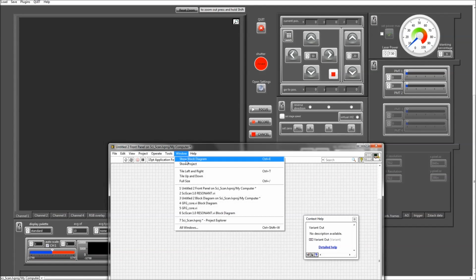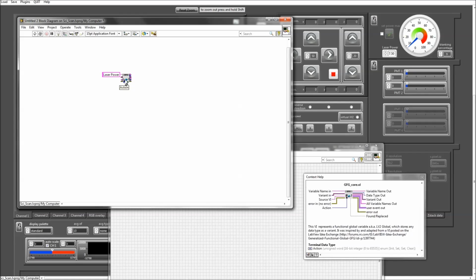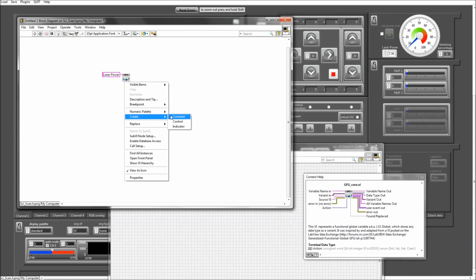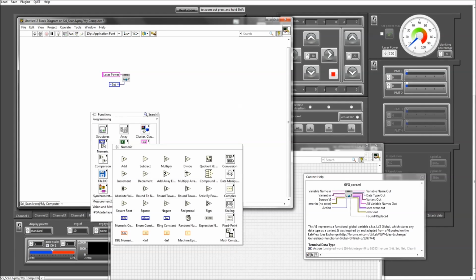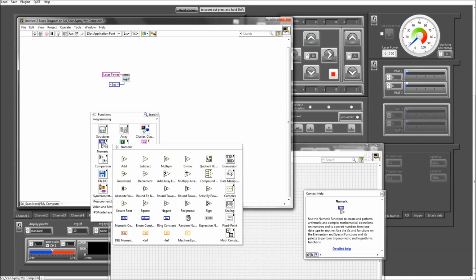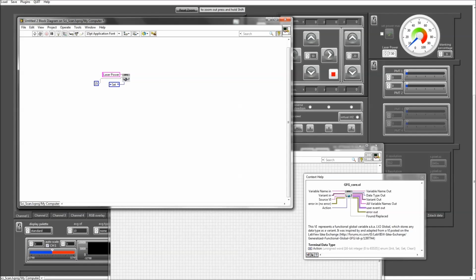Now, this also works the other way around. So now, instead of reading it out, I want to set that value. So to do that, I need to change the action here. So the action is now, I want to set that variable. So I'm going to change this to set. And let's say I have a value here that I want to input. Let's say, for example, I want to set the laser power to 15. I'm going to wire that here to the variant in. I'm going to run that.